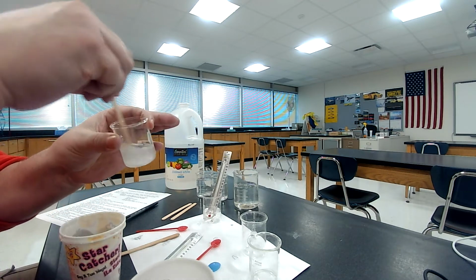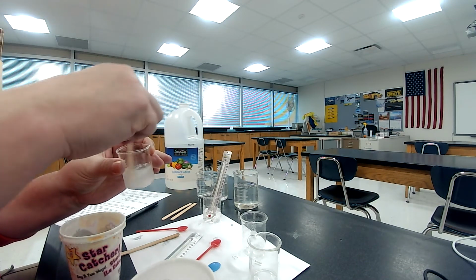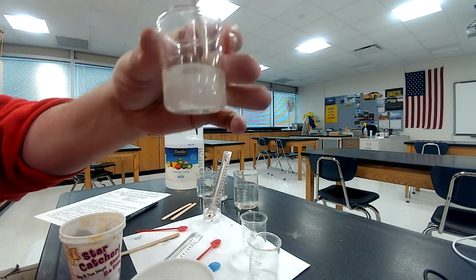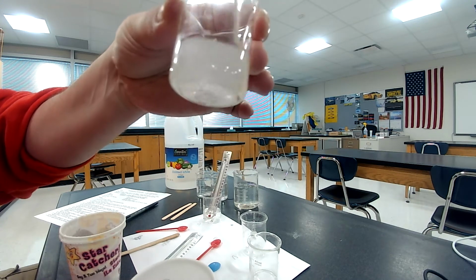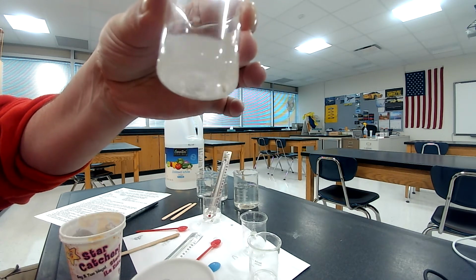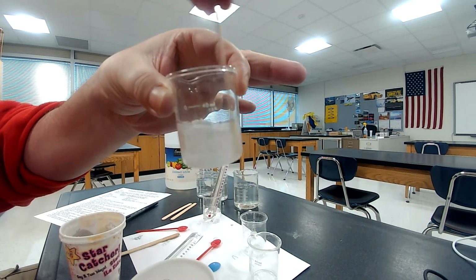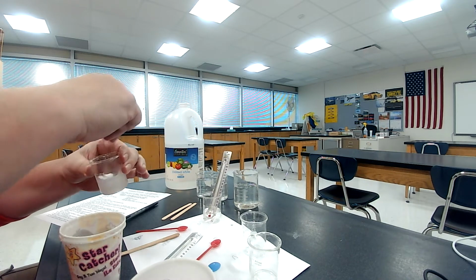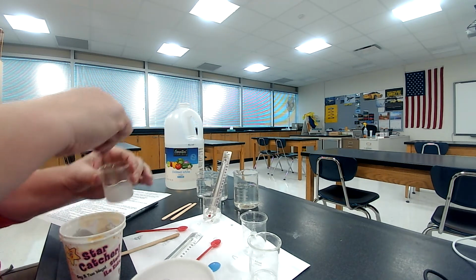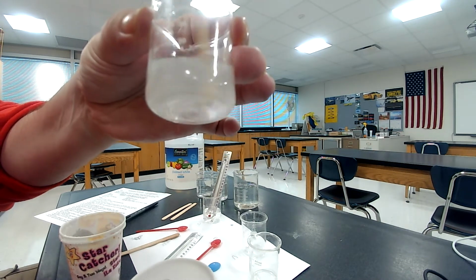Okay, stirring it around here. It says to stir it for 1 minute, so I'm going to keep stirring it. I'll hold it up so you can see it. That's kind of what it's looking like. You can see there's some of them in the bottom that haven't yet dissolved, but for the most part, that's kind of the way it looks. Most of it seems to be dissolving now. There's still a couple little ones on the bottom, but the majority of it.